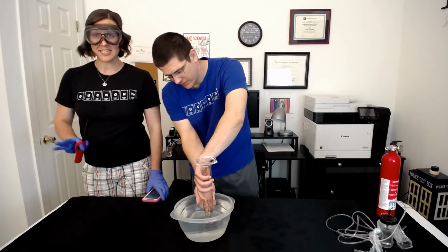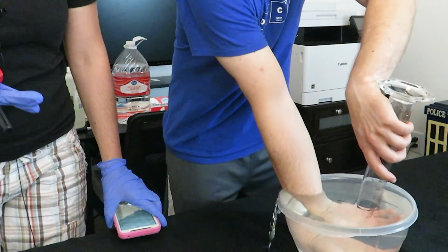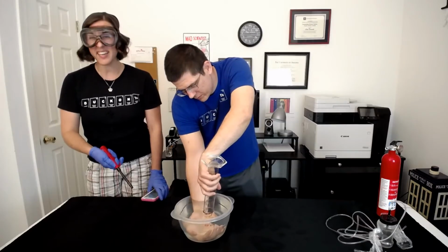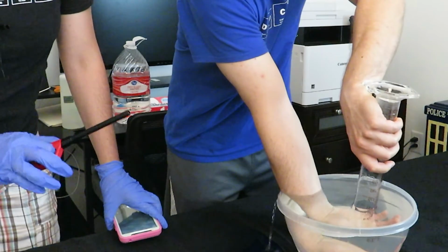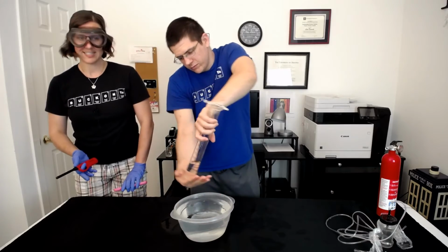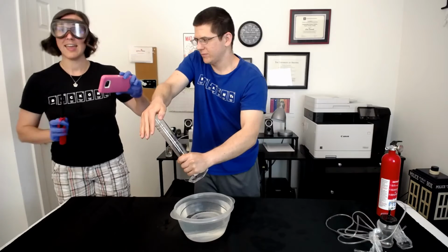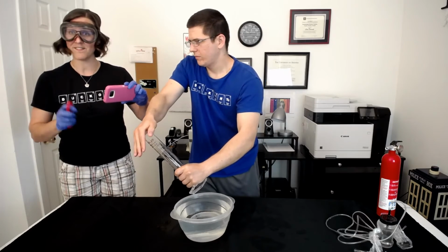So in order to do this, he's going to put his hand under the water and create a nice tight seal on the palm of his hand and the opening of the graduated cylinder. You're probably going to get the table wet when you try this, that's okay. Then, once he's got a nice tight seal so that none of the hydrogen gas escapes, he's going to lift it straight up out of the container and invert it, keeping that pressure on the top so none of the gas escapes. And then, last but not least, working with your partner, you're going to light this on fire.